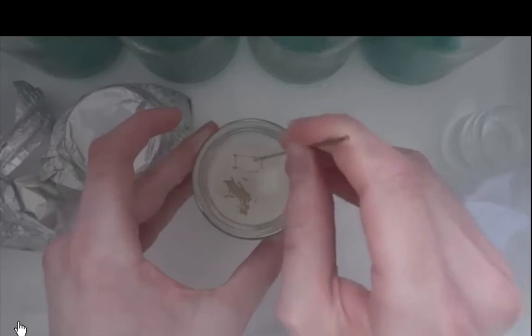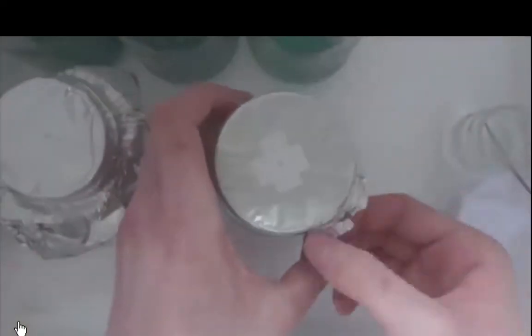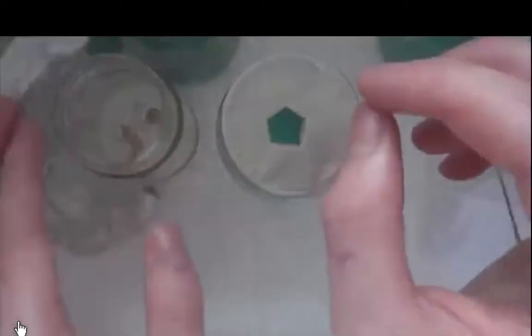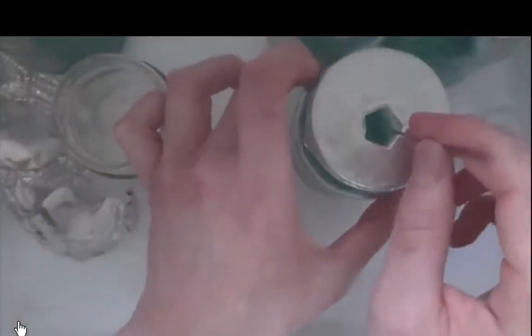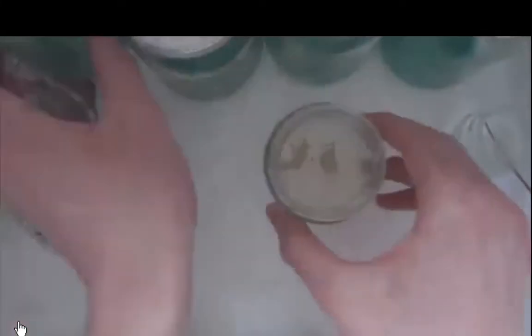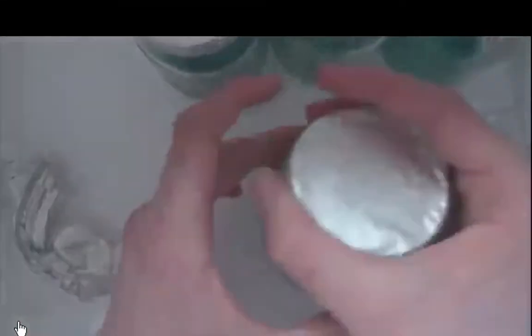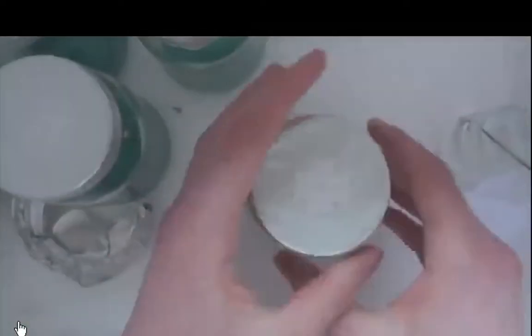Reasonable sized squares, I don't know, half a centimetre to a... He just wiped his tool down with alcohol. He didn't use a burner. Apparently work quite well. Yeah, as you can see, I made 6 more plates, and you can do them really quite quickly. The most time-consuming thing is actually pressure cooking the plates, because I like to watch the pressure cooker, because it is a jiggle top, and you have to occasionally adjust the power setting of the cooker.